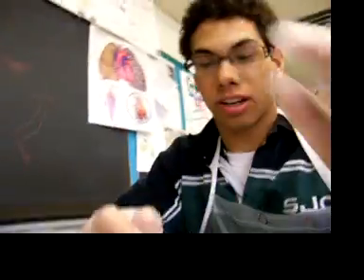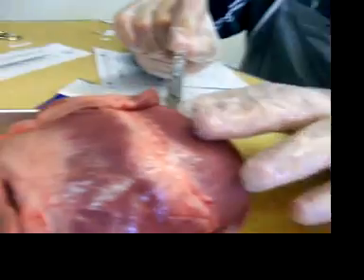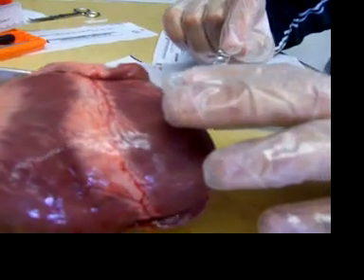I'm making a video right now. You gotta come up through here. I don't know what you're talking about. Show me. I don't want to... So I cut through here. Don't come up through here. Just turn. I'm not touching the camera with this hand.